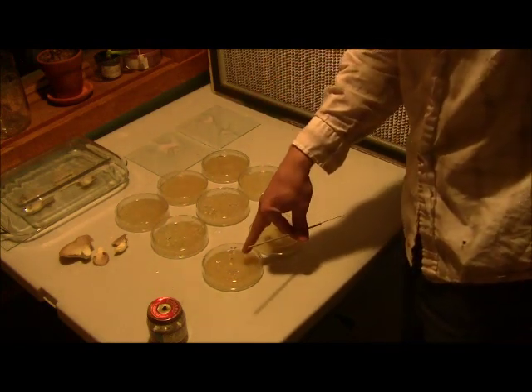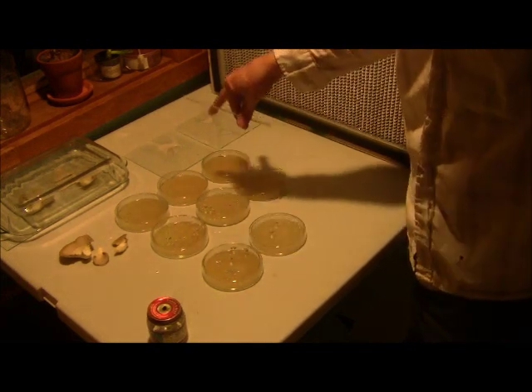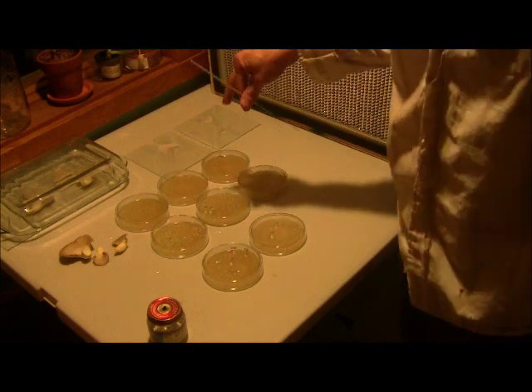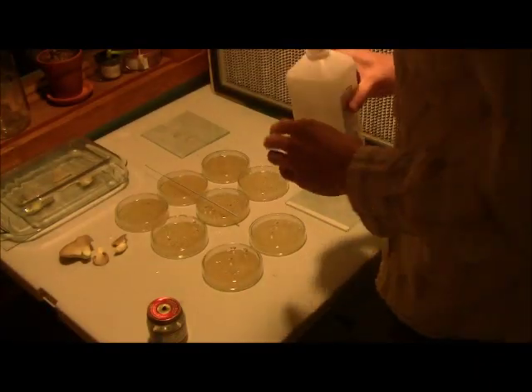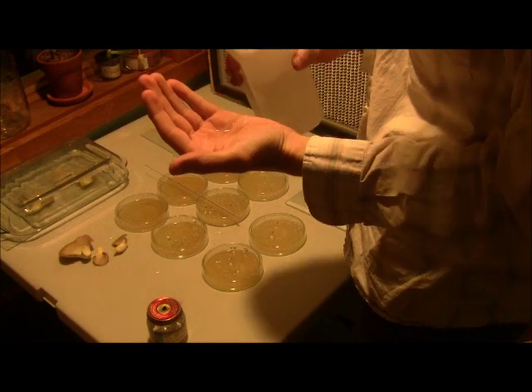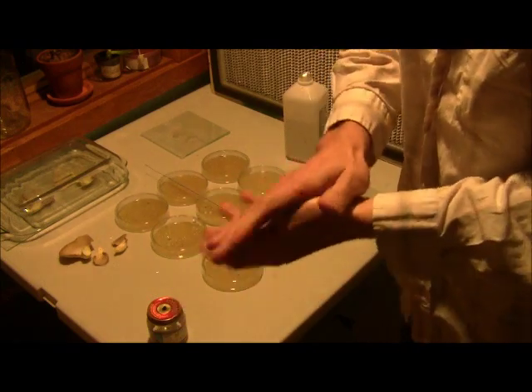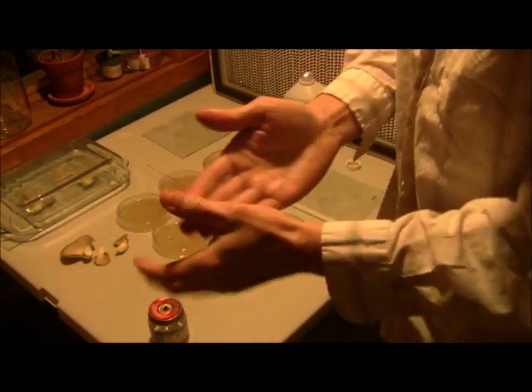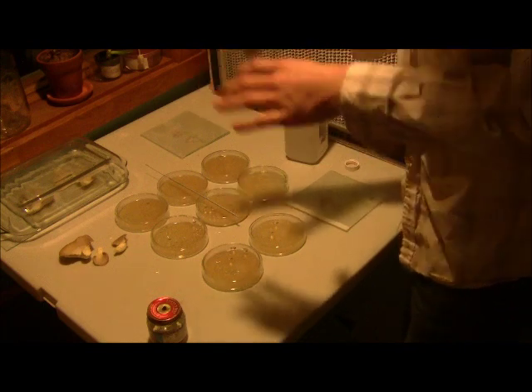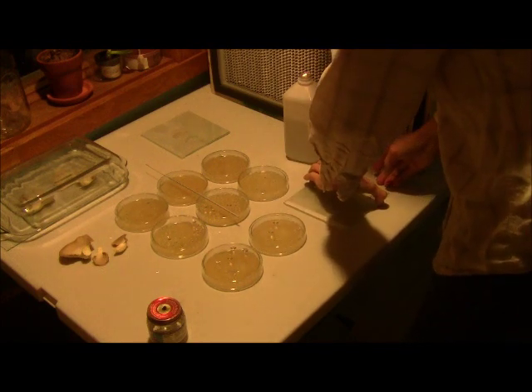I'm doing my own testing with frozen glass slides to verify that freezing them works okay. I grabbed the one from the freezer — it got thrown into the mini fridge freezer. I use a mini fridge for keeping all this stuff: once grain spawn is ready, I put it in the cooler to slow it down, otherwise it keeps growing at room temperature. There's also a little freezer in there where the spore slide ended up accidentally. I re-sterilize the loop by burning it again so I'm not cross-contaminating.